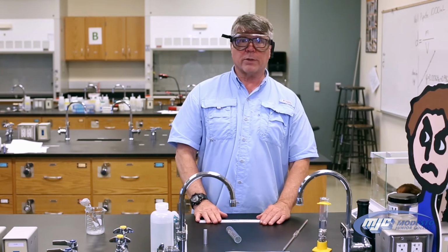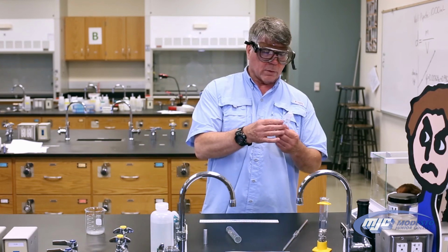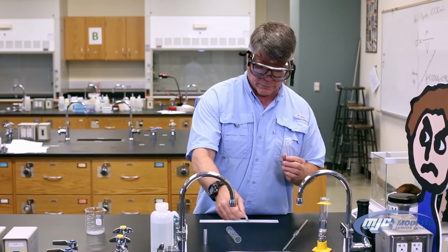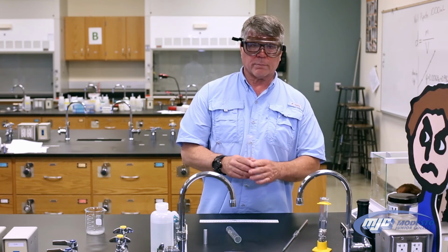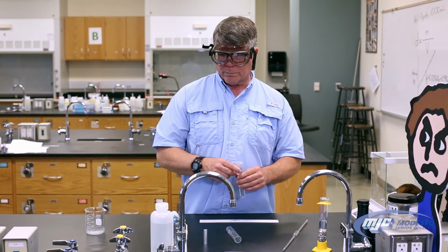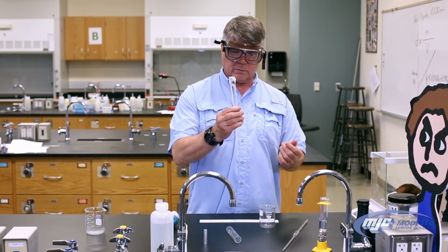And the third part, the unknown salt solution. Once more, unknowns come with an unknown number. So if you're actually doing this in the lab, take the unknown number off, place it in your data table. And if you're just getting the data at home, you will not have an unknown number. So we need to know the mass of 10 milliliters of this solution.